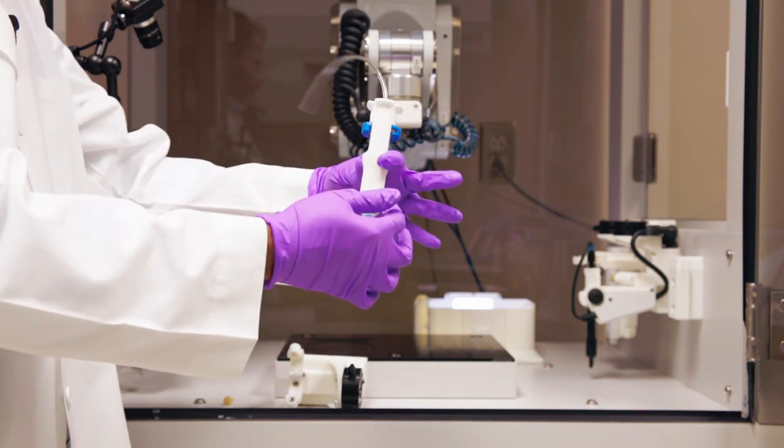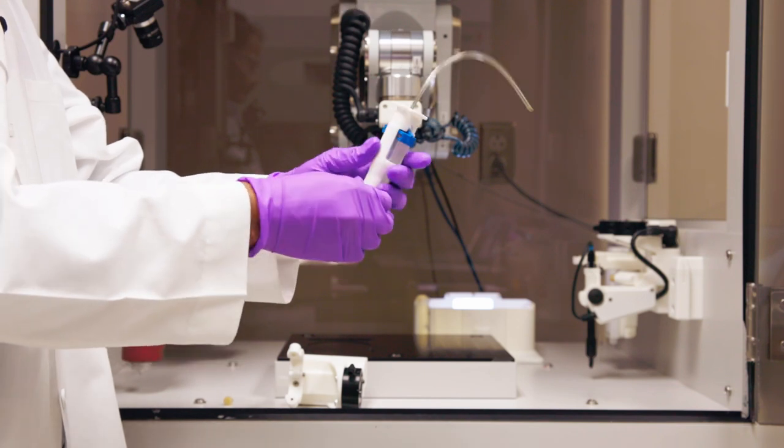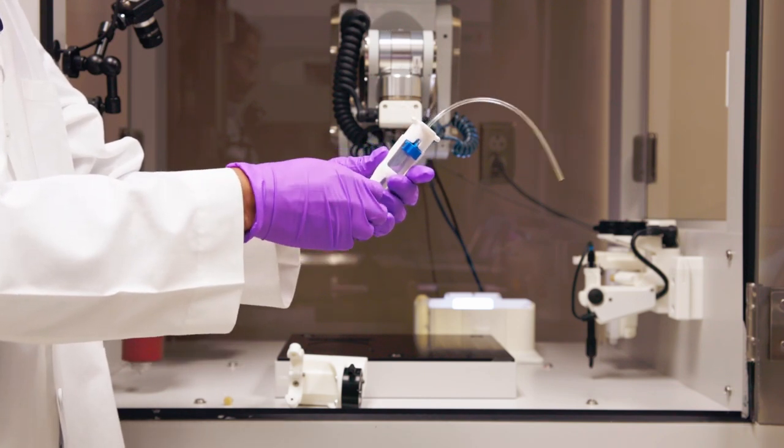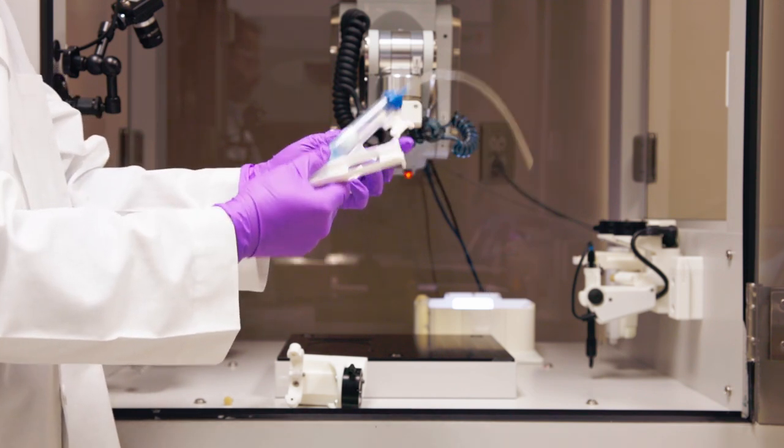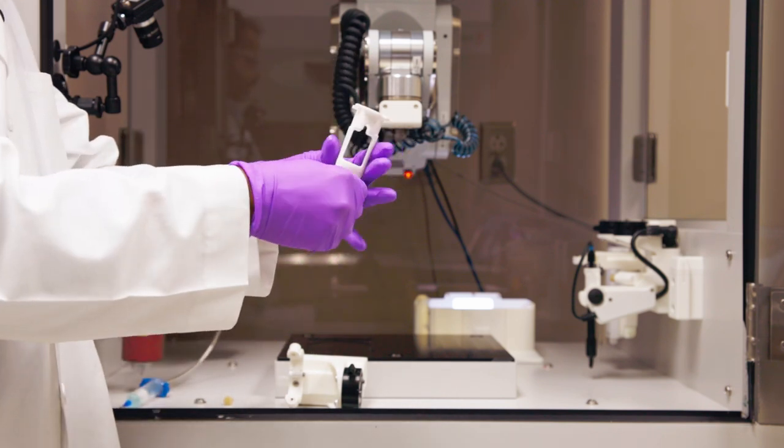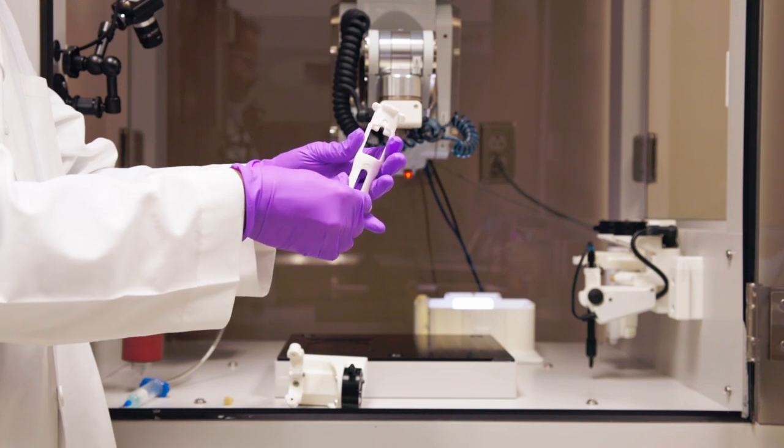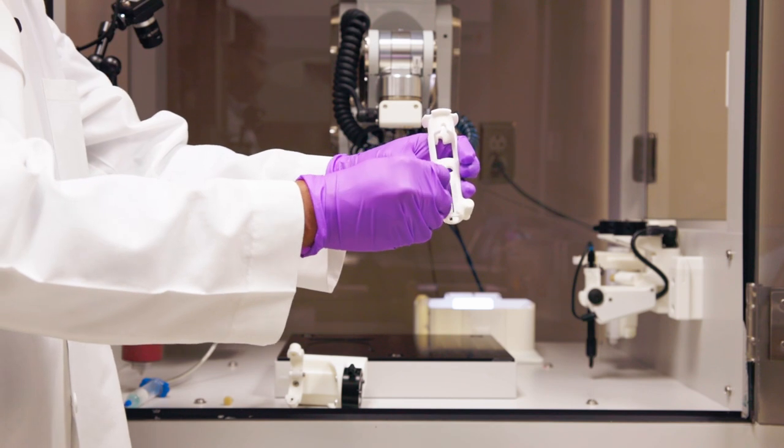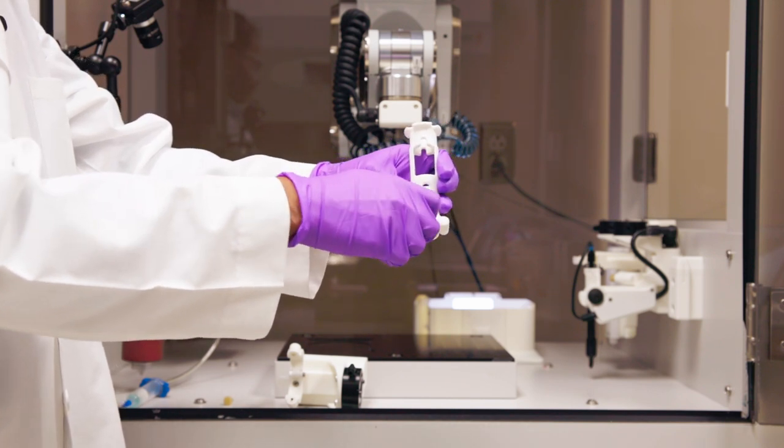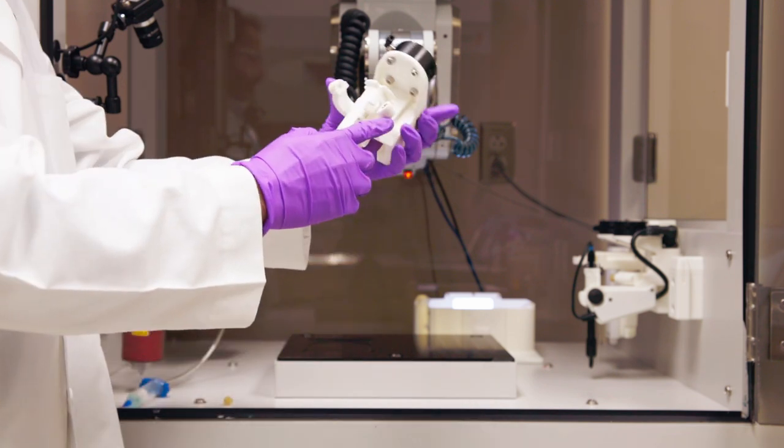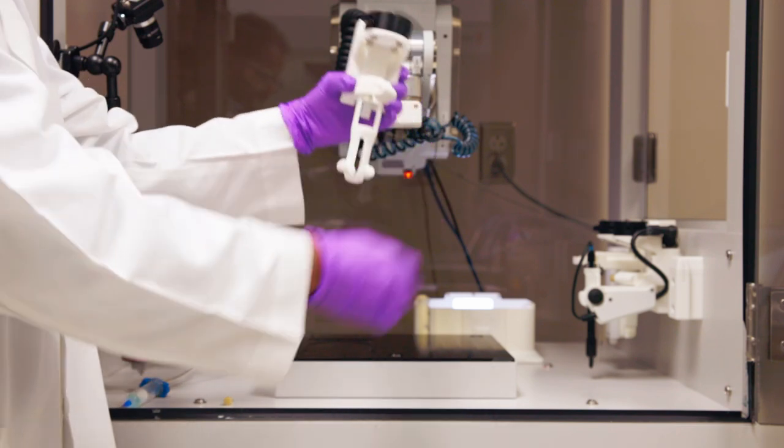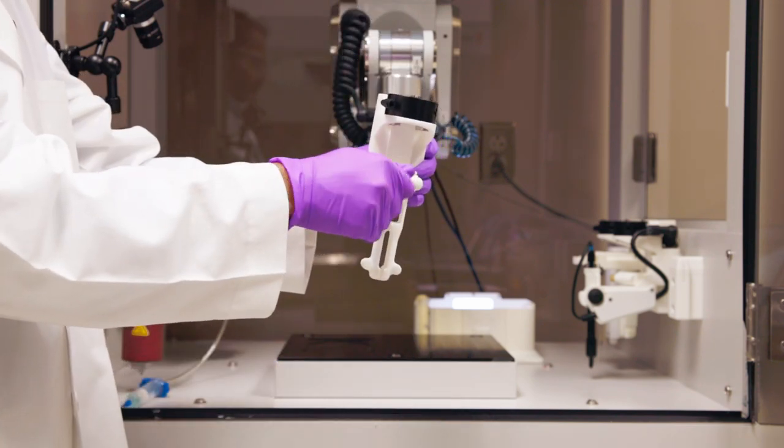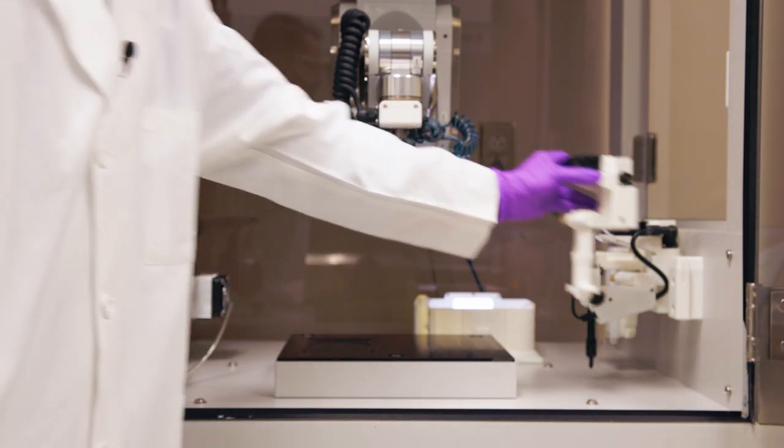Remove these two screws on the adapter. Now, remove the syringe and put the screws back on the adapter. Place the adapter back into the printhead, and fasten this screw. Put the printhead back into the bay.